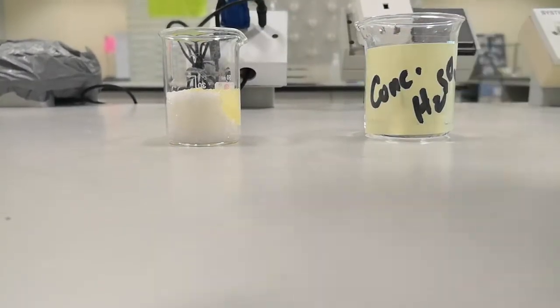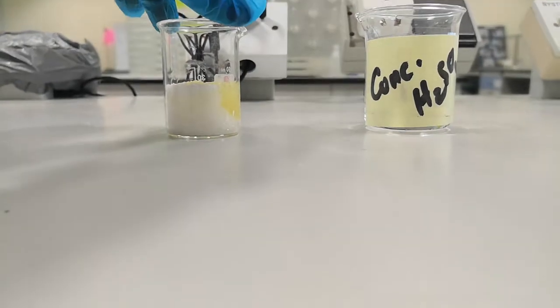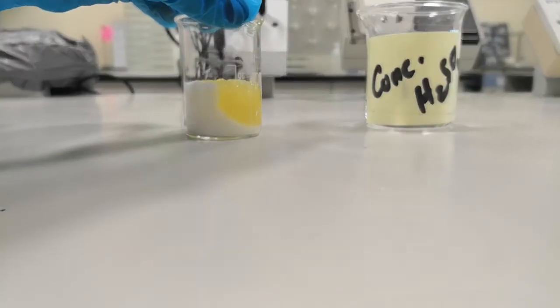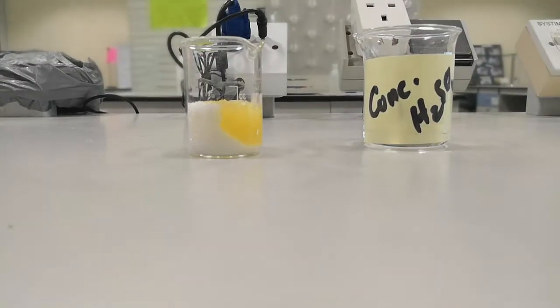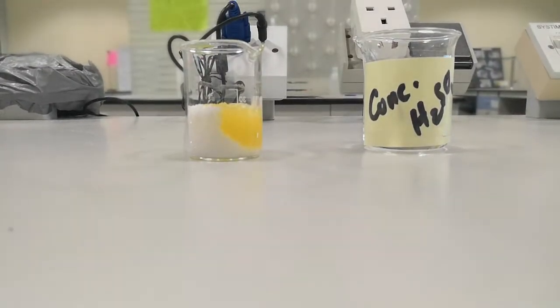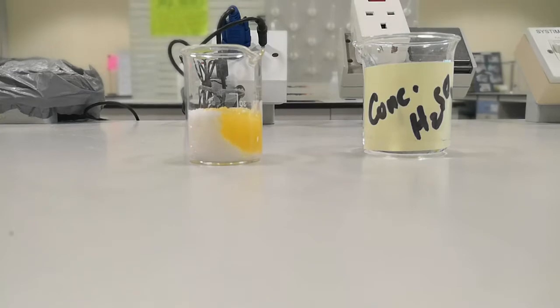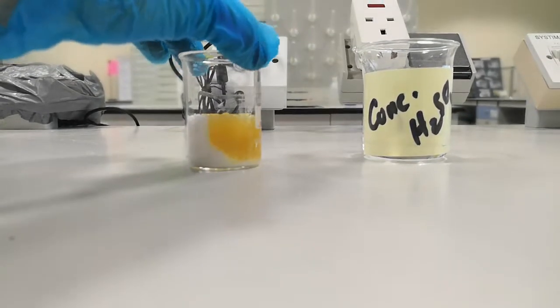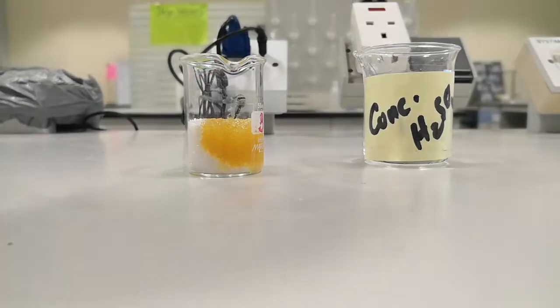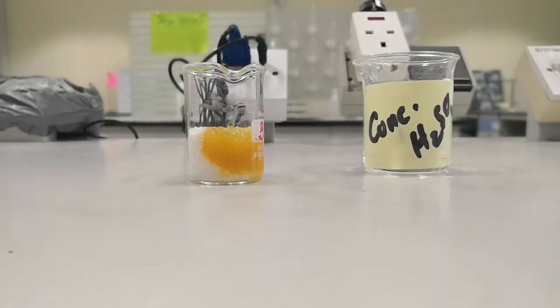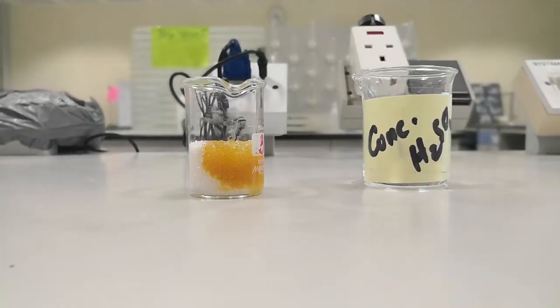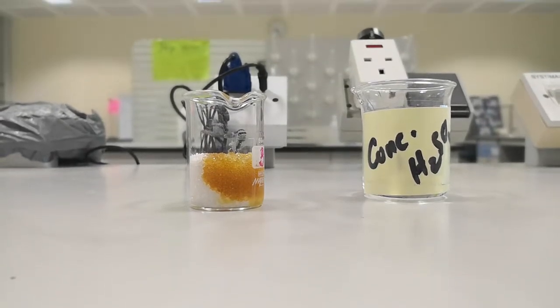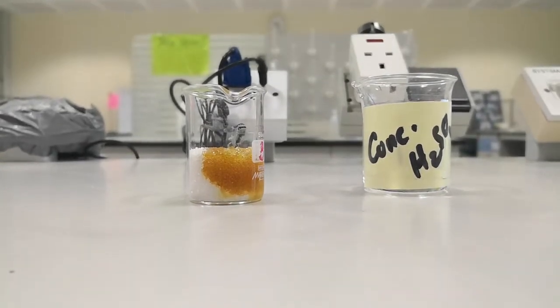First it will start reacting with the sugar, turning it into yellow, then brown, and then to black. But of course it takes some time. See, the color started to change to brown.